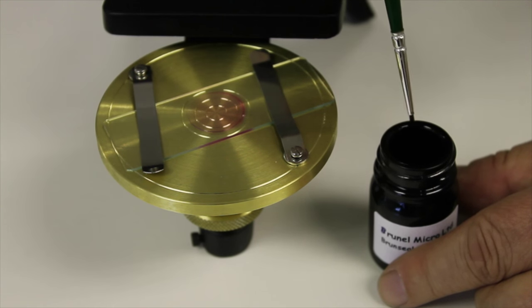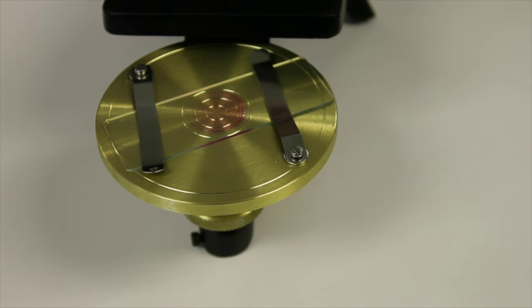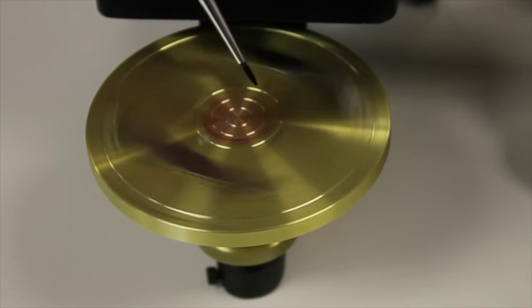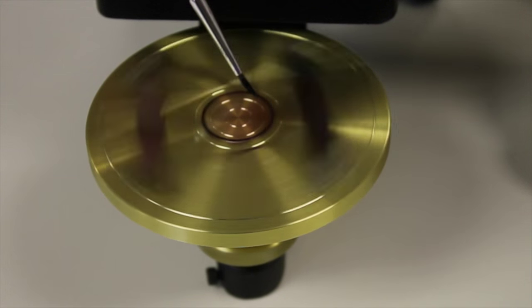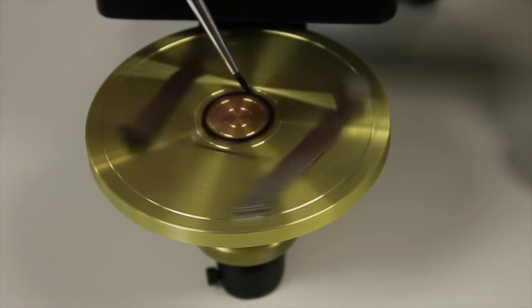Load but do not overload a small paintbrush with the cement. Using the wrist support, angle the brush in the direction of spin and lower it onto the edge of the coverslip, allowing the cement to be drawn from the brush onto the slide.